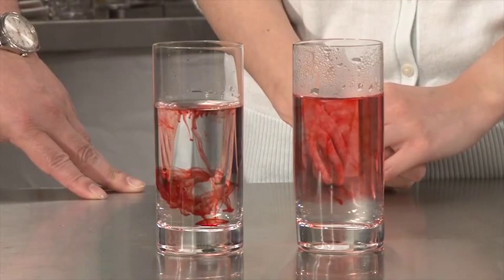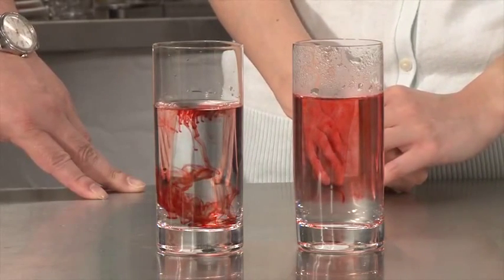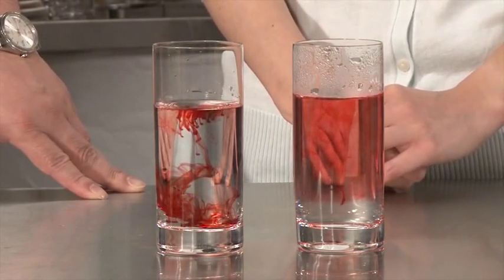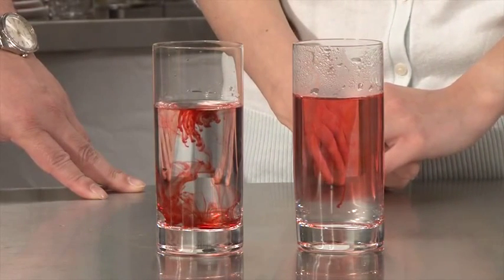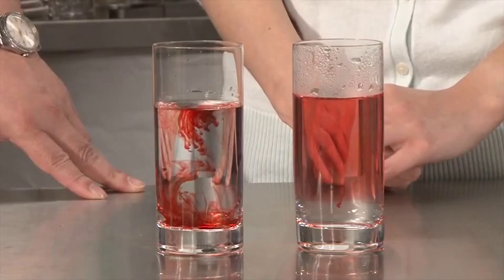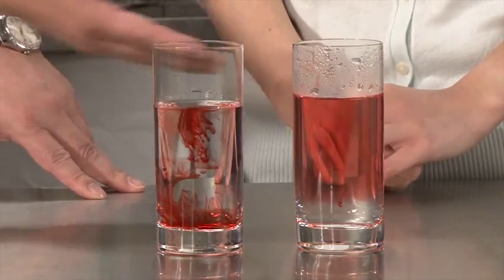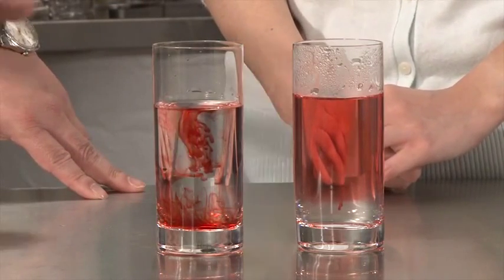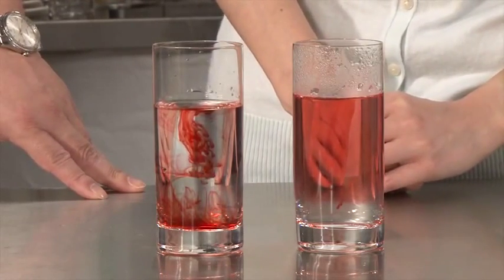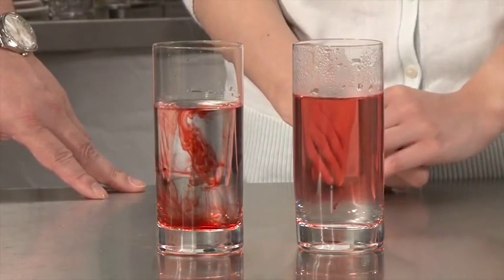You may notice that on the left-hand side where the water is cold, sometimes you find that the dye is stagnant, they're not moving at all. Based on the very slow Brownian movement, they are simply moving a little bit, but then they're not really mixed very well. But if you look at the right-hand side, you may recognize that you can't see the dye at all. Basically, they are almost like a mix-up in a homogenized solution form.